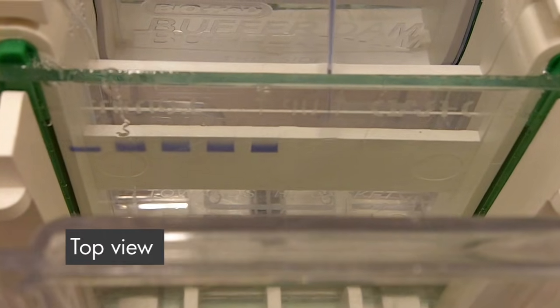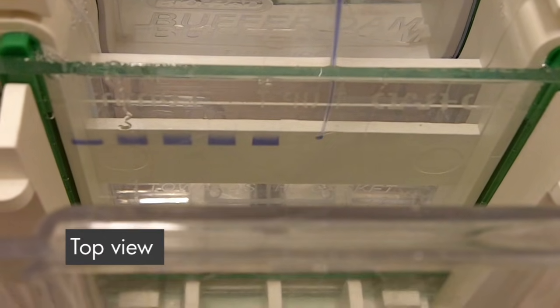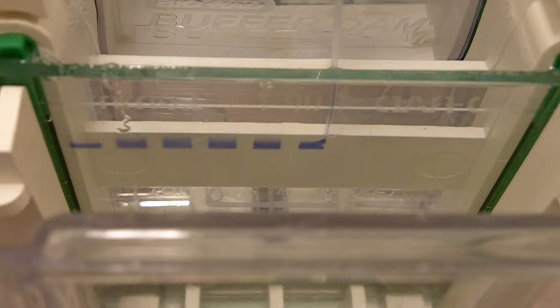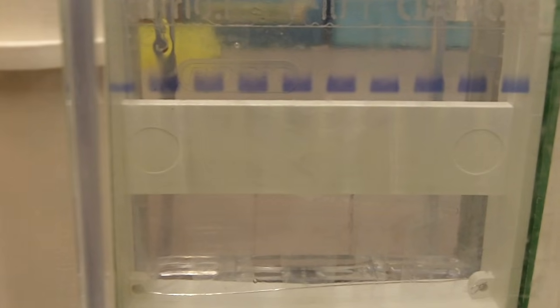And then you just keep on loading it till every well is filled. There you go, all the samples are loaded.